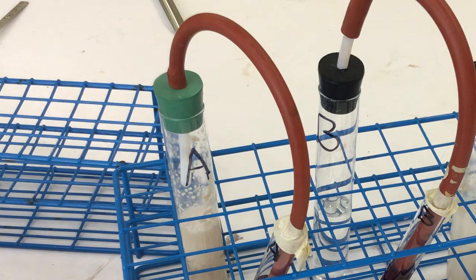Using the color of the bicarbonate indicator shown here, as well as the photo of this initial setup that will be given in the lab document, record the contents of each tube and the initial color of the bicarbonate indicator in the test tubes in the table associated with this exercise on the assignment worksheet.